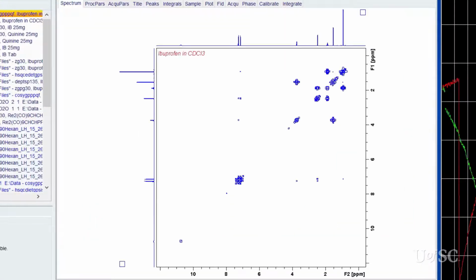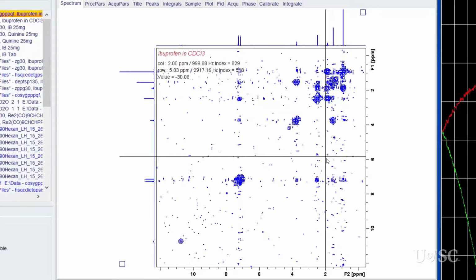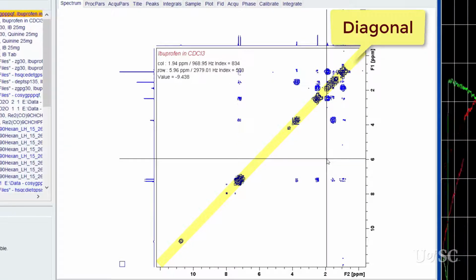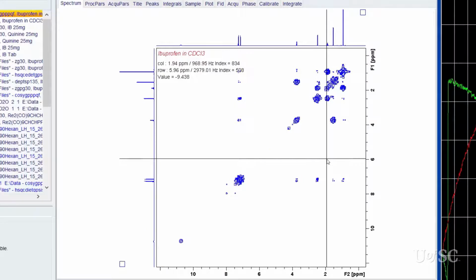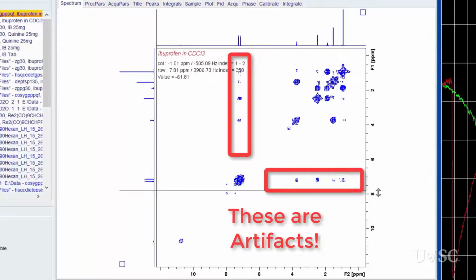Moving on to the COSY result, we see the data as it was automatically processed. As part of the processing, Topspin performs a symmetrization along the diagonal. This is a shortcut that is supposed to eliminate unwanted noise or artifacts. However, ridges of noise in both axes can meet, and the routine can mathematically produce artifacts that can be mistakenly confused with real cross peaks.